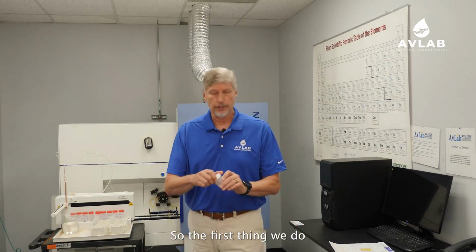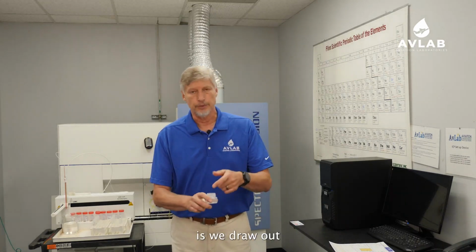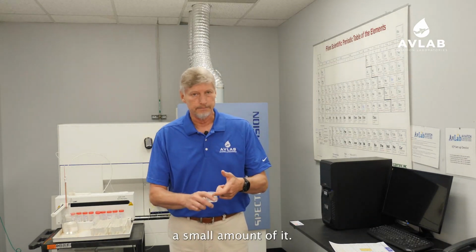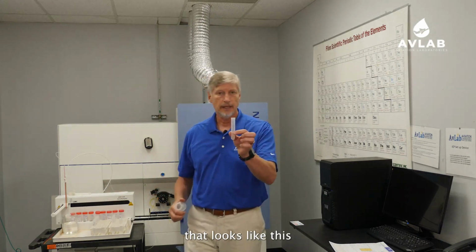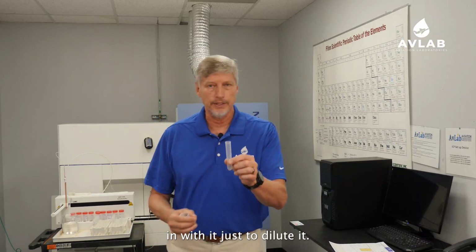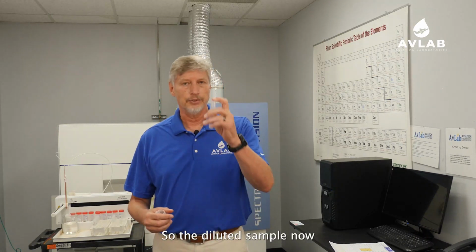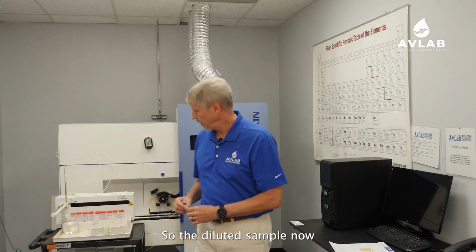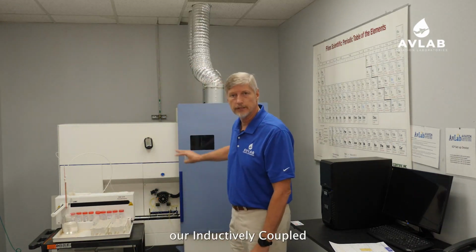All right? So the first thing we do with the oil sample that you've sent us is we draw out a small amount of it. We put it into a test tube that looks like this. And we put some solvent in with it just to dilute it so it's easier for us to get it through the instrument.